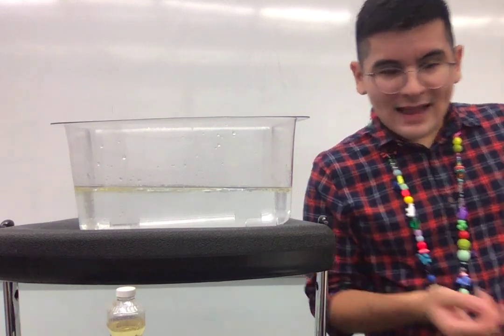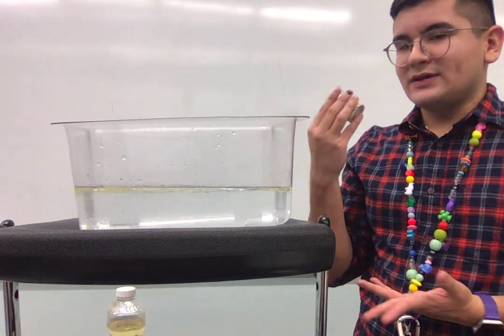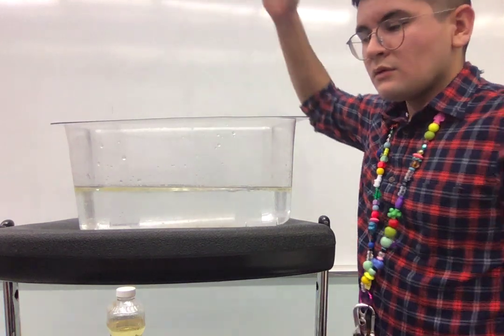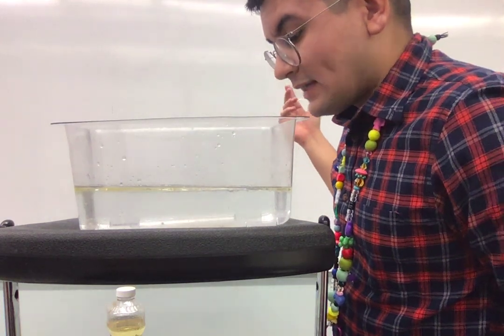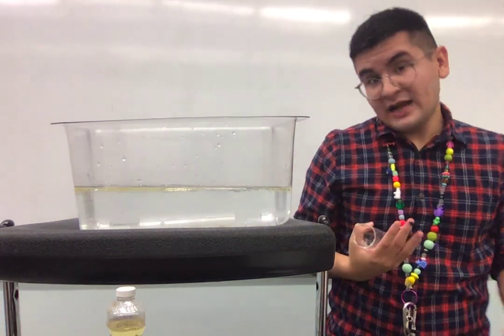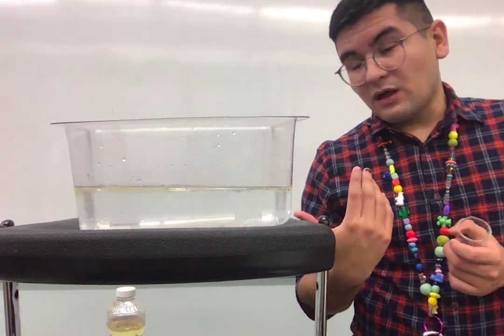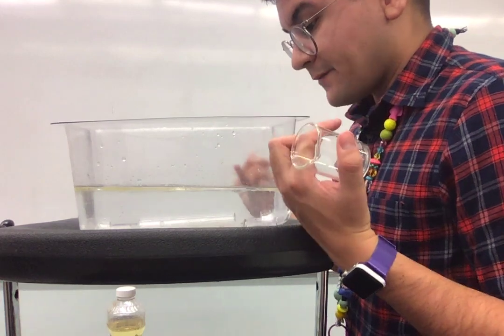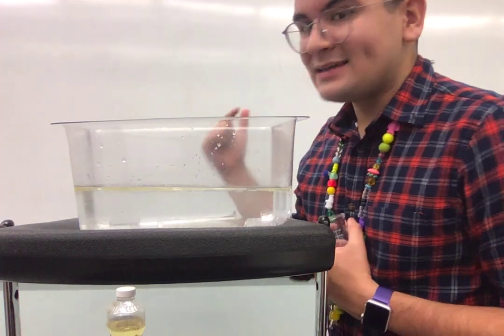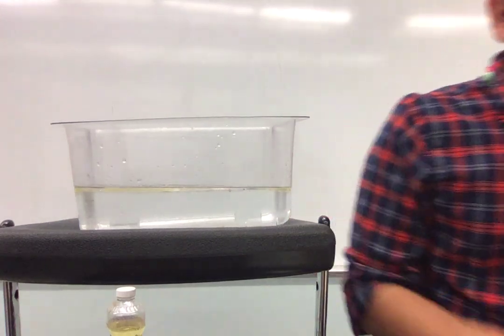And then last but not least, we're gonna try sand. So I've got my cute little beaker here. I love it, it's so cute. And we're gonna just drop it in, see what happens. Ready, 1, 2, 3, boom. Ooh, I could see a lot of sand still in there. So if you didn't know, sand is made up of just tiny rocks and seashells. So rocks don't dissolve, right? So sand doesn't dissolve. And I can still see it perfectly in there. So is the sand soluble or not soluble if I can still see it in there? It did not dissolve. What do you think? Write it down in your assignment.